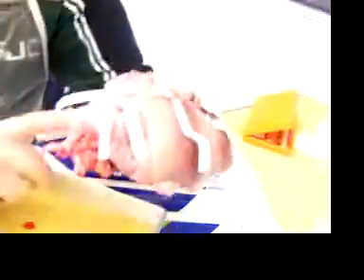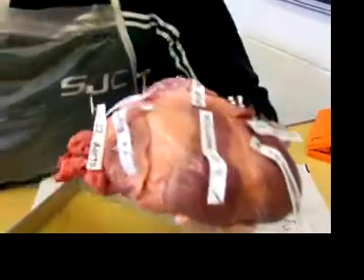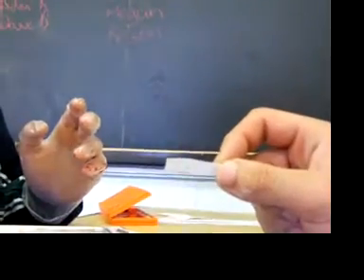Let's just start sticking this stuff in. Mr. G, we don't know where — our superior vena cava has been cut out. Do you stick it inside? Let me stick it in. Is that hole there? There you go. So this is the right atrium — we got that right. And the superior vena cava takes the blood in.